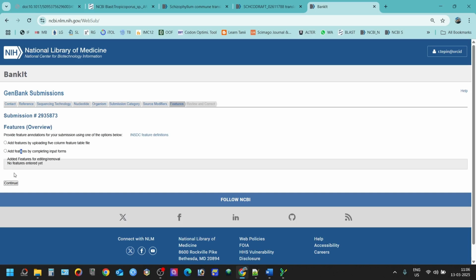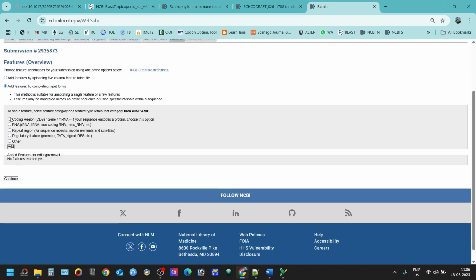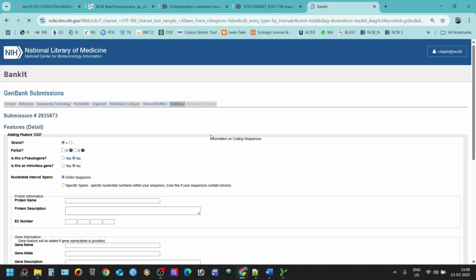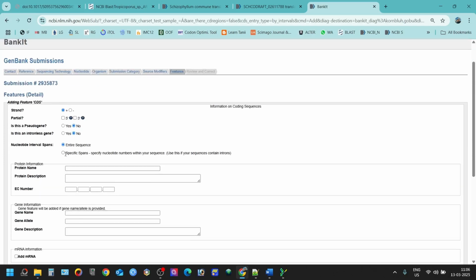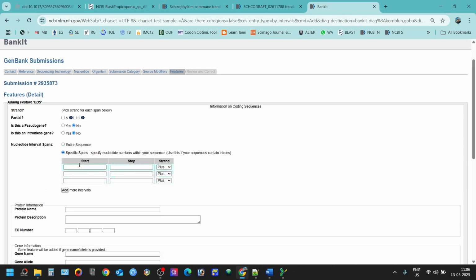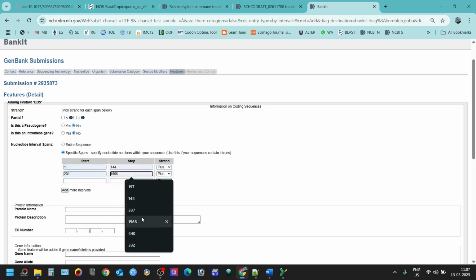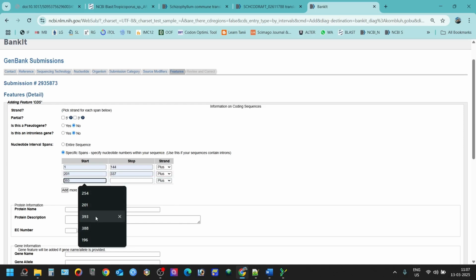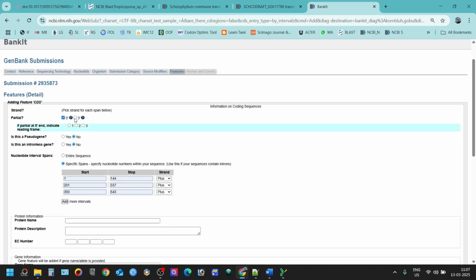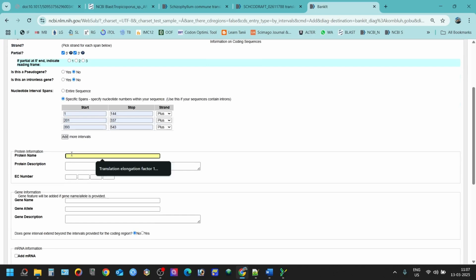Just add features, coding, providing intervals, add, and we have to specify the sequences: 201 to 337, and 393 to 543. So you can click this one here, like previously what we have done.